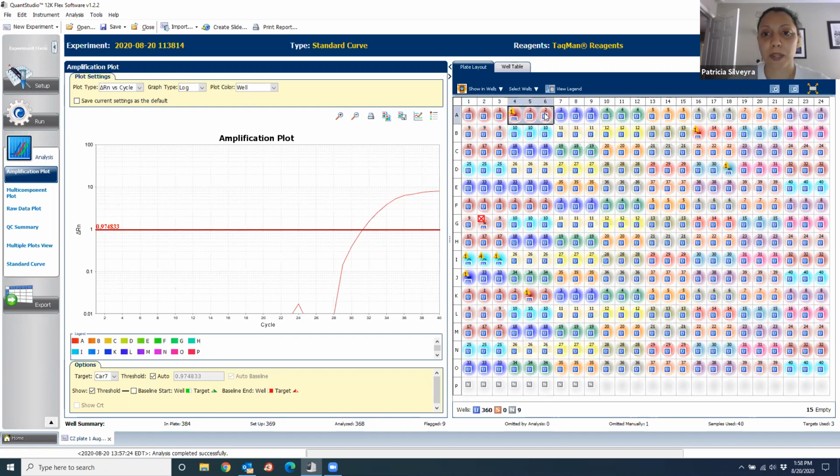So here's your triplicates, right? So this is your first sample, sample 1. When you pipette it in triplicate, it basically looks exactly the same in the 3 wells, right? It's almost no difference. This is perfect pipetting. Congratulations, good on you, because that's you pipetting well, the reason that it looks that way.